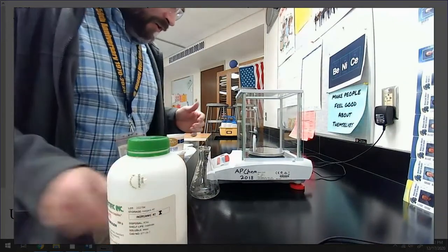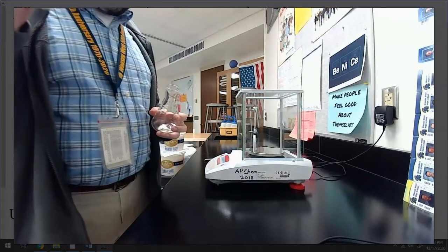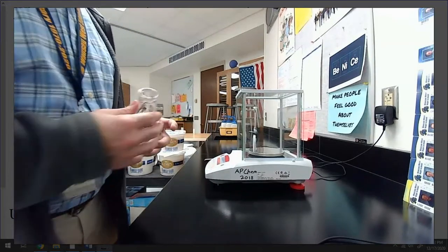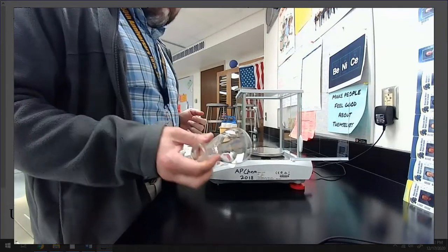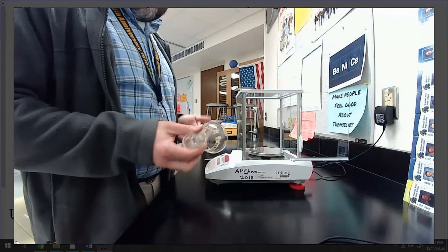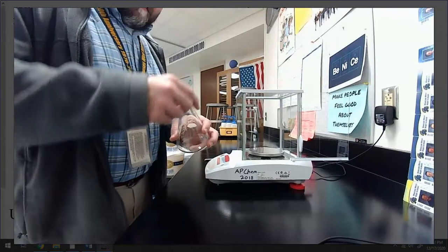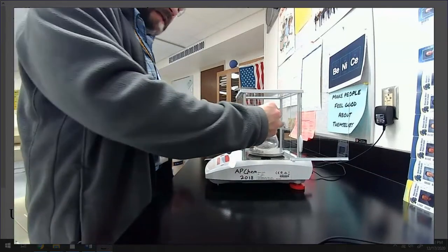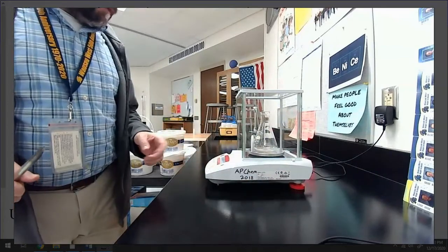Anyway, what I'm going to do now is get the mass of my unknown acid. Okay? So this is unknown acid A. I'm going to try not to show you what it is. But let's use our balance. I'm just going to measure it right into my Erlenmeyer flask. I could measure it into a different little tray or container and then transfer it to the Erlenmeyer flask, but there's a chance that I'm going to lose some of it along the way, and I don't want to take that chance. So I'm going to measure it directly into my Erlenmeyer flask.